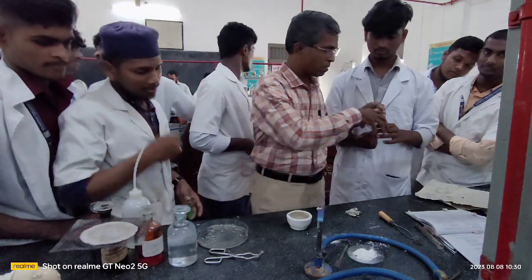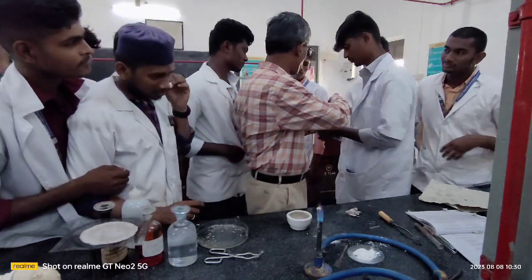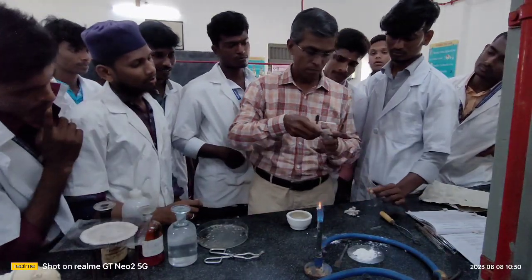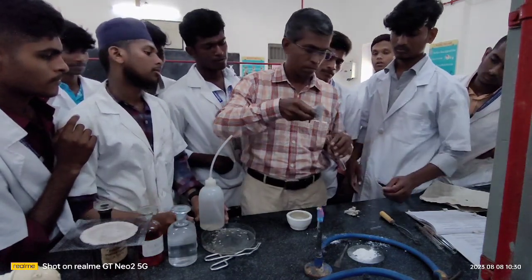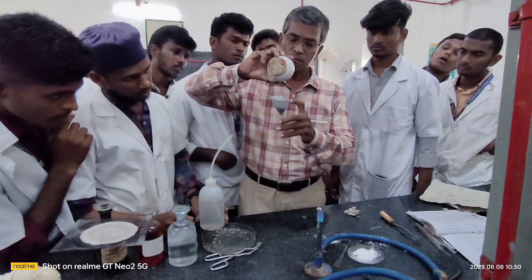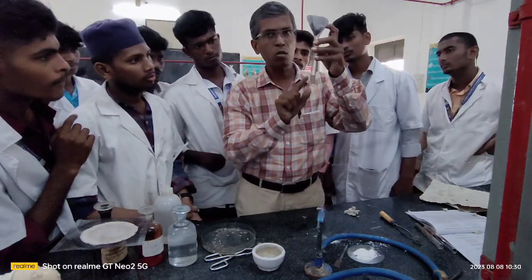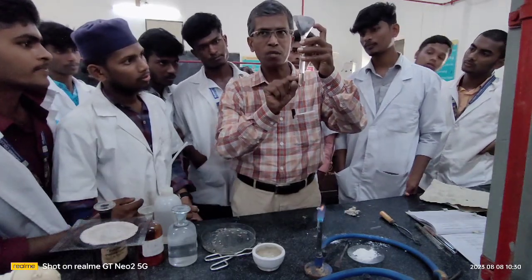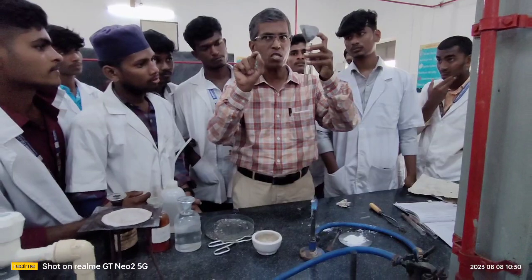Almost grinding over. There is filter paper. Filter it. The extract you are receiving after the filtration is called sodium fusion extract. This is the extract you are going to use to confirm the presence of elements in your organic compound. In particular, your focus should be on the nitrogen.